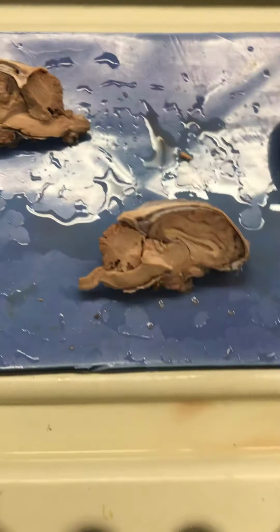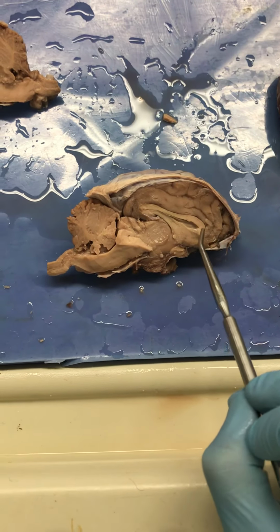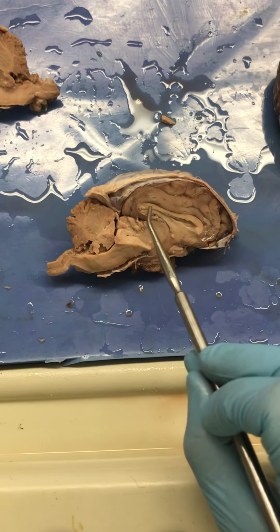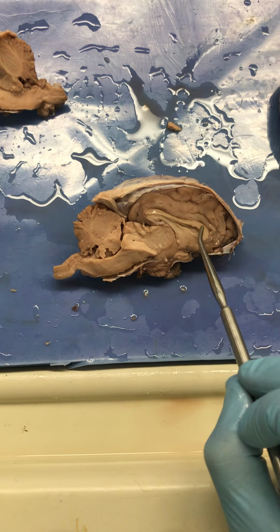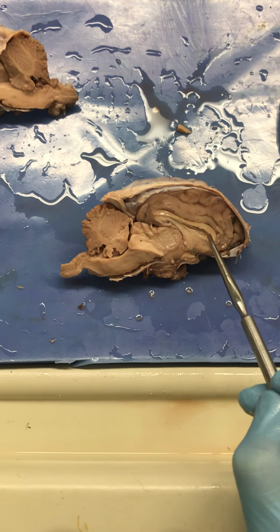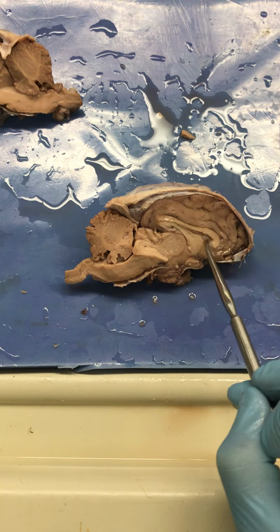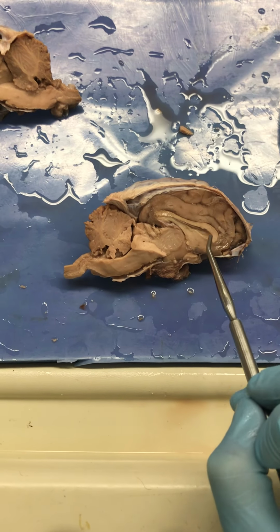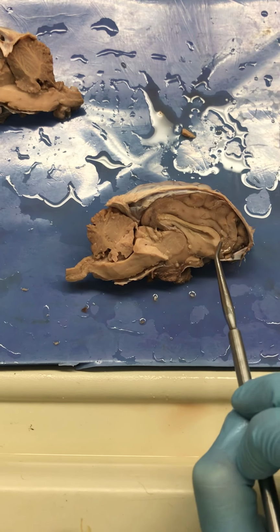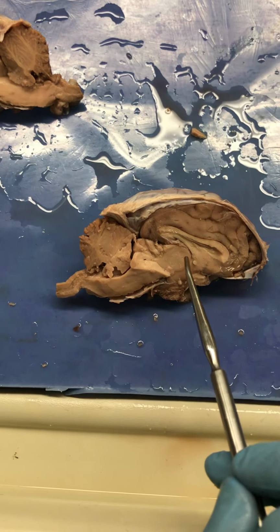And now let's look at the interior of the brain here. I cut this brain in half, and I wanted to show you the corpus callosum, which connects the right and left hemisphere of the brain. It's a white matter tract that allows for communication to go from right to left side. And we've got some ventricles in here, and then this thin membrane, the septum pellucidum. And around here we have the fornix down here, and things like that you see in your worksheet, okay?